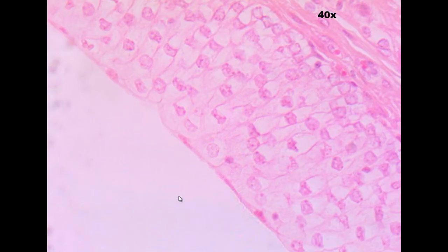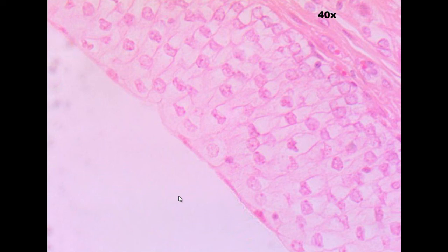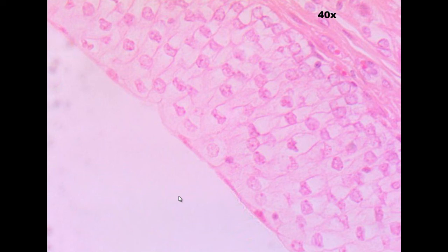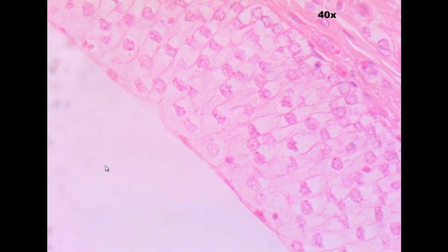This one: does it have cilia? No. Does it have a single sheet of cells that are irregular, or is it small spaces surrounded by a single sheet of cells? No. Does it have little buckets of cells? No. Does it have square shaped cells? No. Are they rectangular? No. Then do they look like they're overlapping and resemble a peacock or balloons? Yep, they're overlapping. That's going to be transitional.